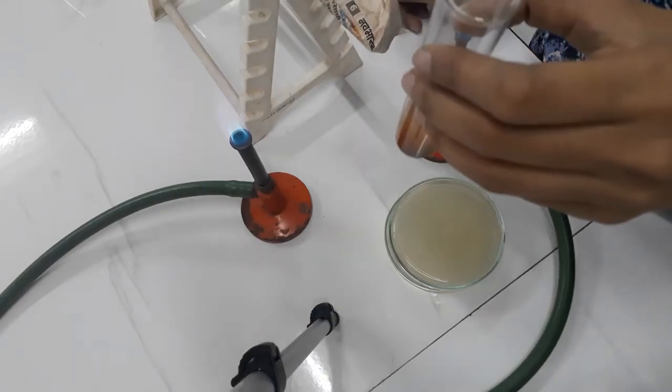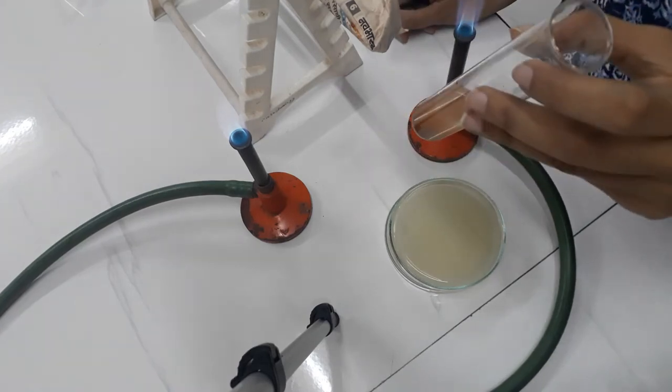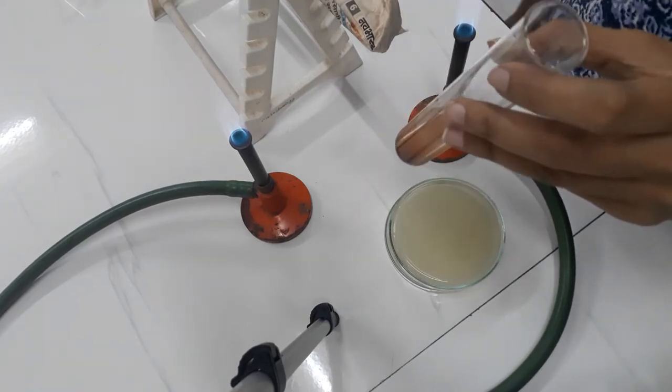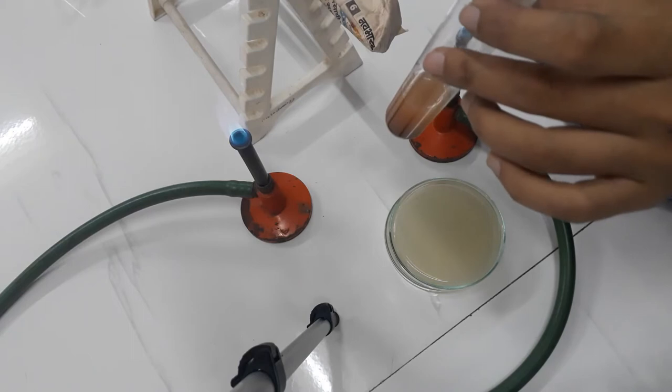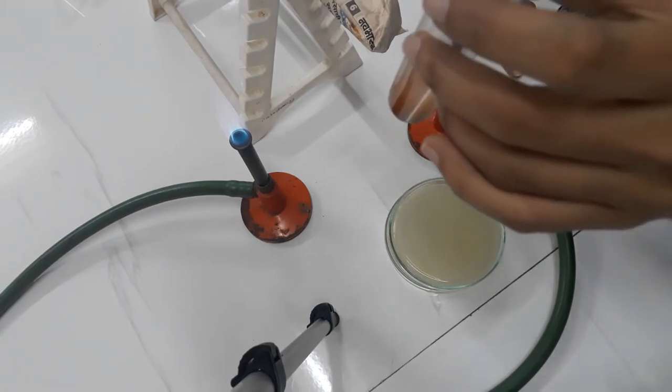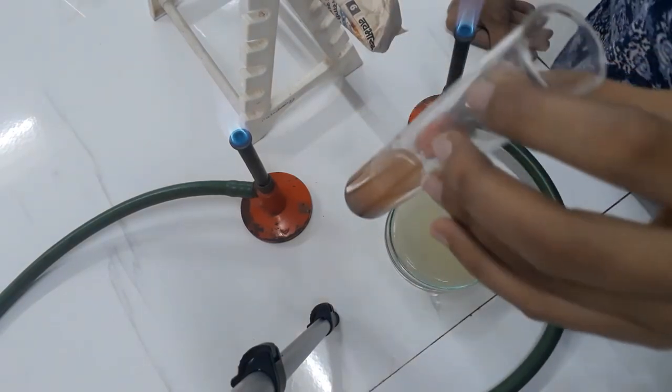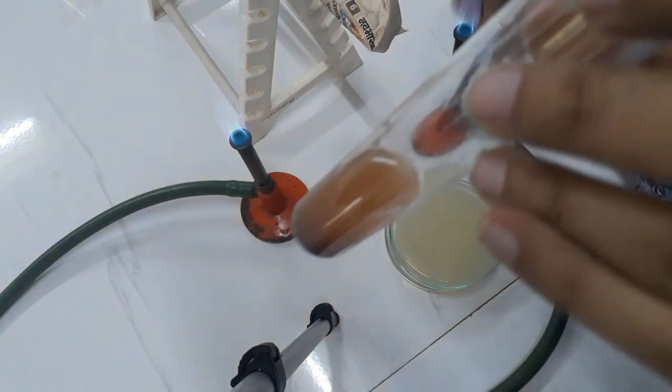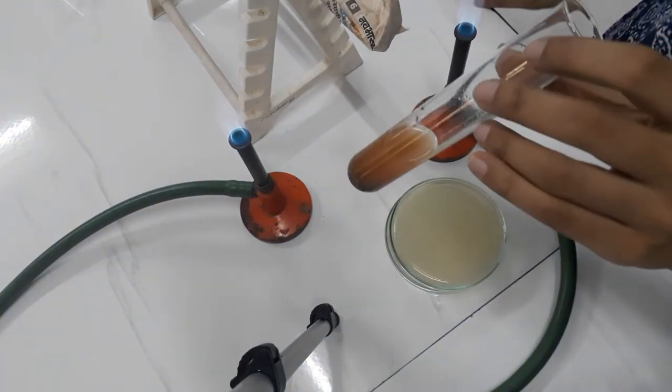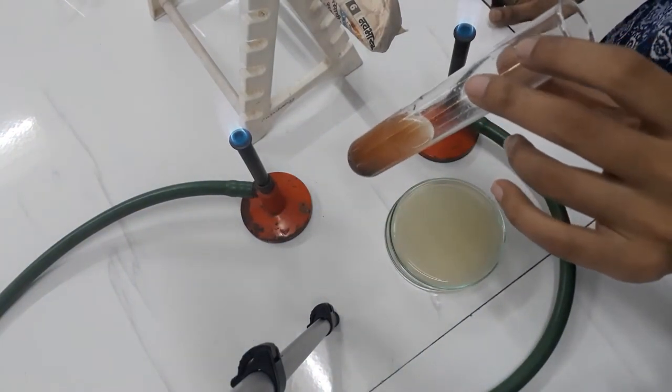Okay, so we are now going to start with an experiment which is crowded plate technique. We had seen that we had mixed the soil and then let it settle. So after settling, this is how it looks.